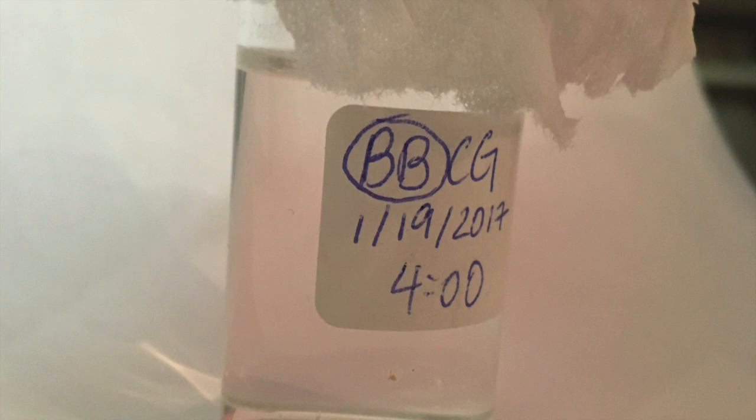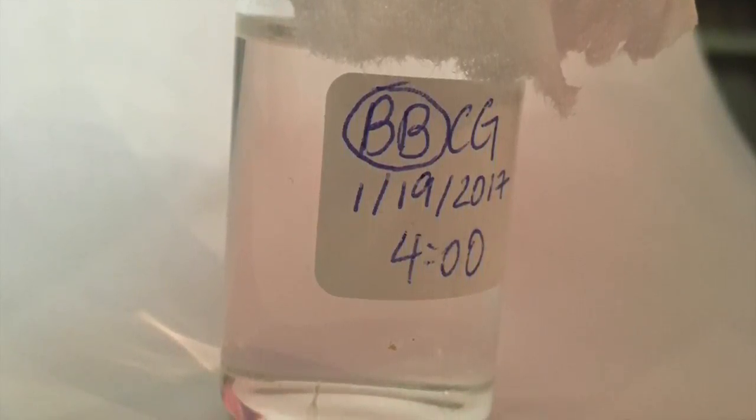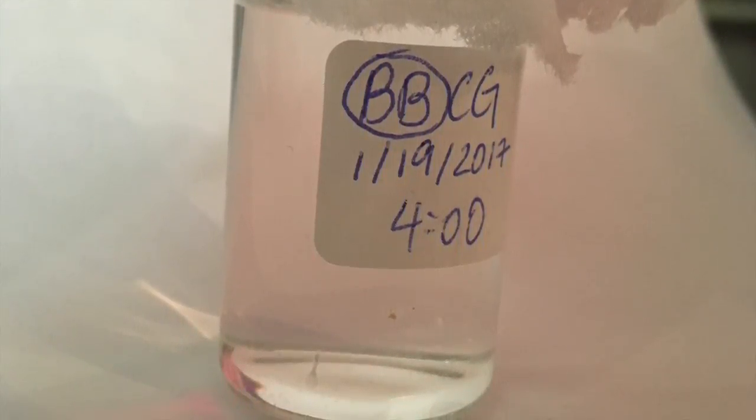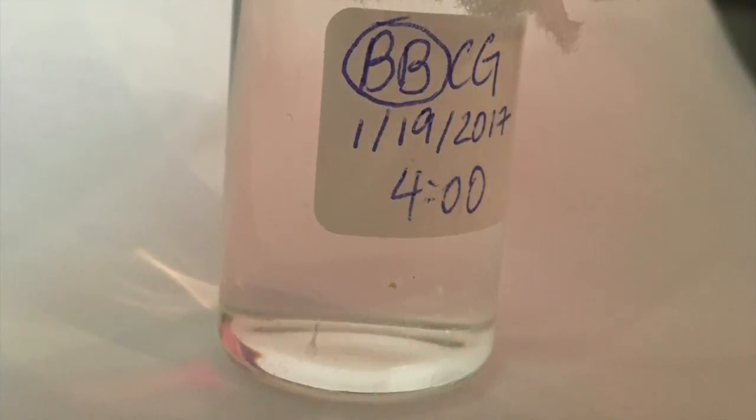There are a few environmental factors that could be affecting the crystal growth. First, the day after I took the last video, I changed the Chem wipe on top so that it was a single layer instead of a triple layer to improve the Chem wipe's breathability. In hindsight, this could have agitated the system and could have undone any small crystalline growth that may have occurred.